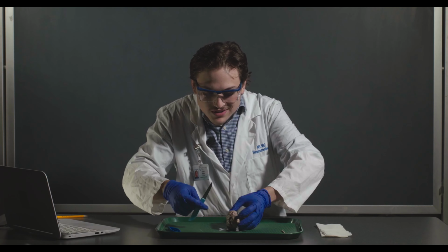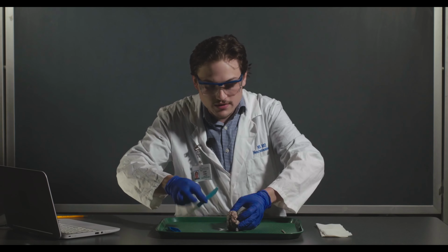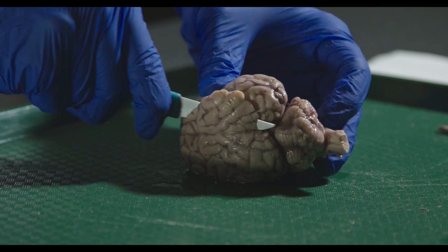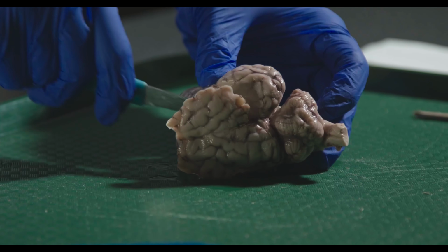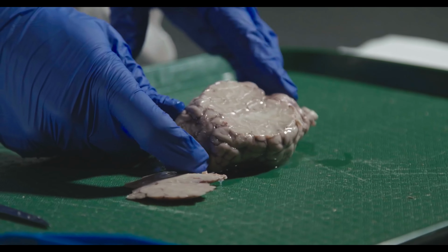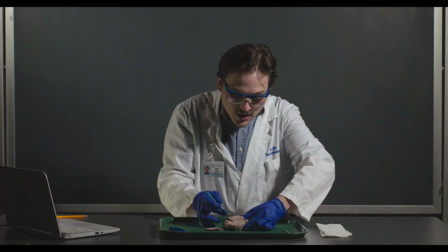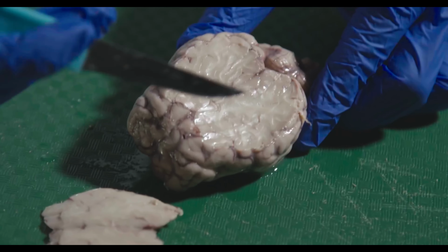So I usually don't see it until I start to get to where the cerebellum is. So for the first couple of cuts, you can be pretty liberal. So I'm going to go ahead and shave some of these. So you can see here that we didn't quite reach it yet. So the white matter is again in here, and you can't really see any kind of fanning out into a sheet, so we need to keep cutting.